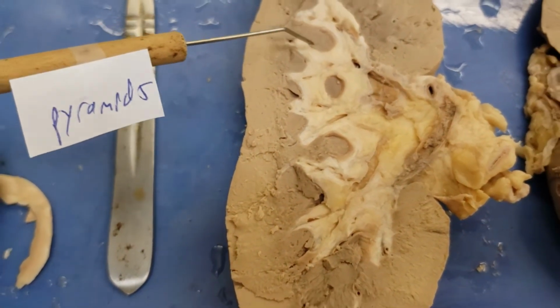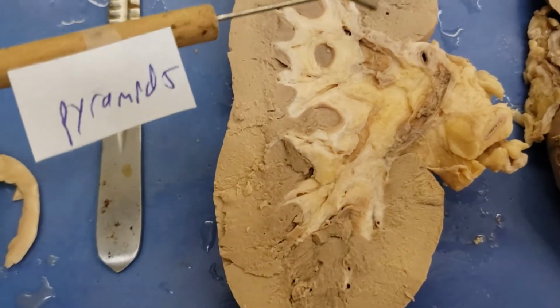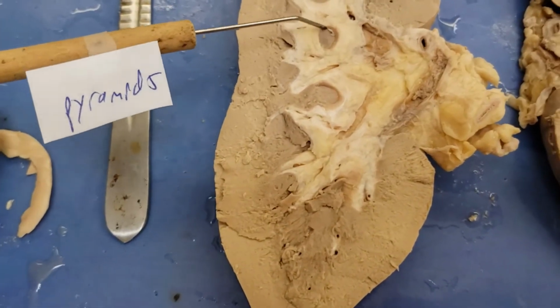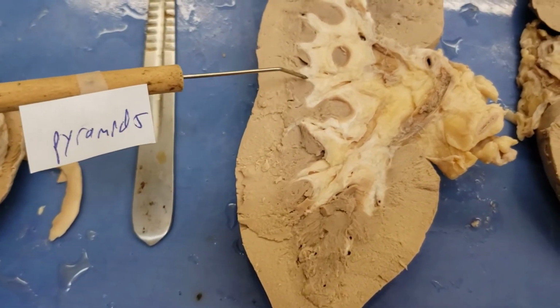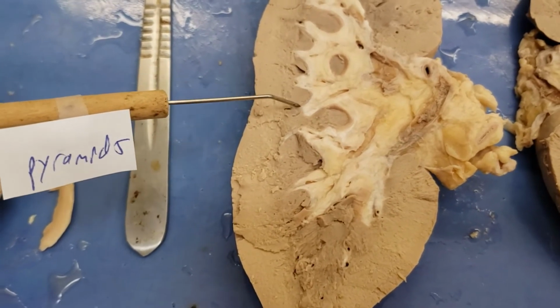The kidney is one of my favorite organs. I really like the urinary system in general. How it works is incredibly fascinating and also somewhat simple. Deceptively simple, I would say. And they've also got pyramids in it, and I love pyramids. I've always been a huge fan of pyramids. I even saw a basketball game played in a pyramid once, so it was pretty awesome. So this is pretty cool. That's a nice looking pyramid. That ain't bad. Yeah, pyramids.